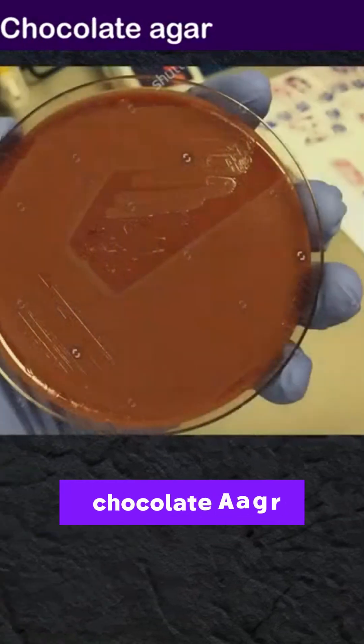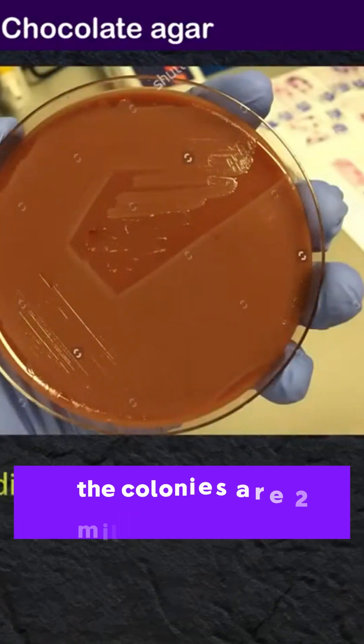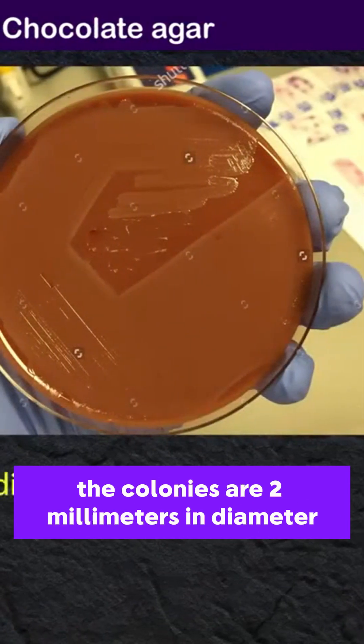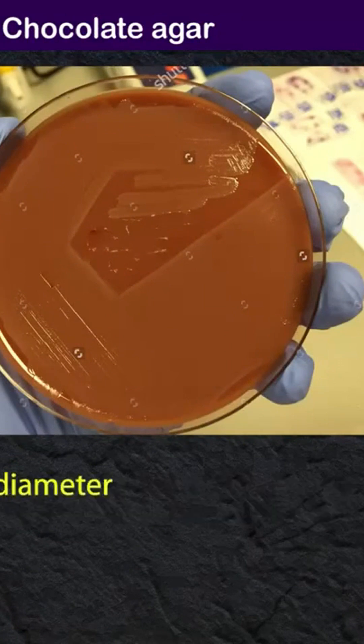On Chocolate Agar, the colonies are 2 mm in diameter and gray-white in color.